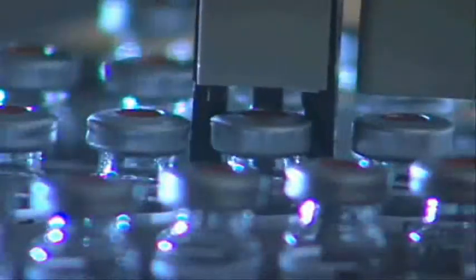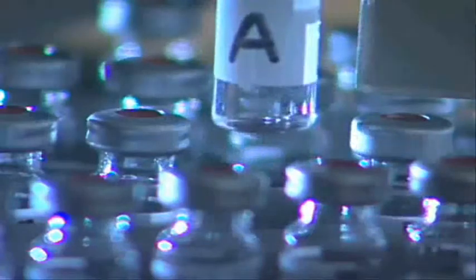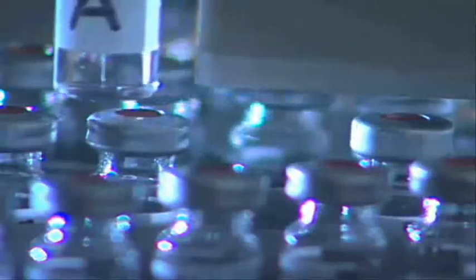The vials are placed on an auto-sampler tray and the liquid is injected into the gas chromatograph. Three samples are run.